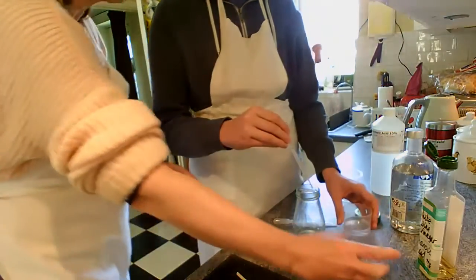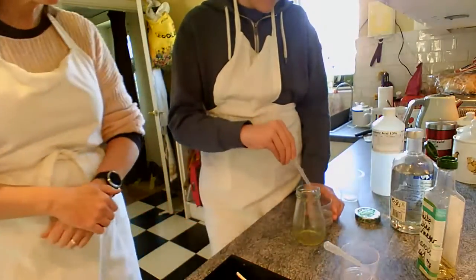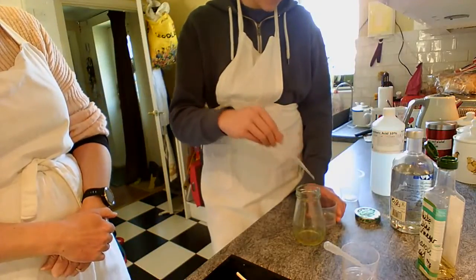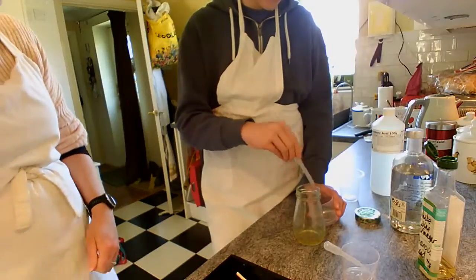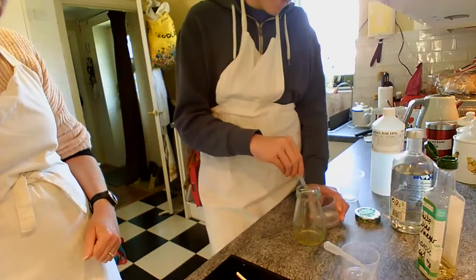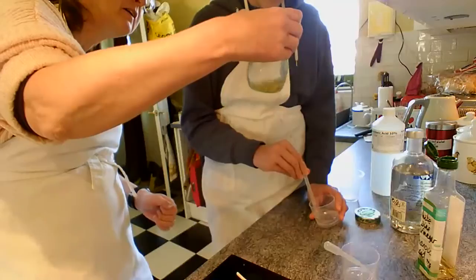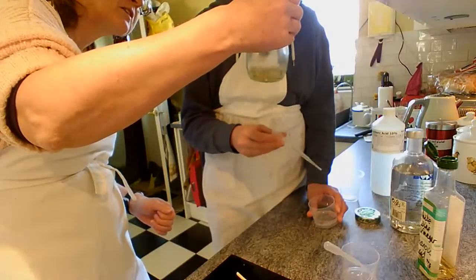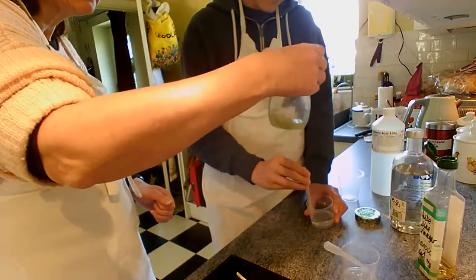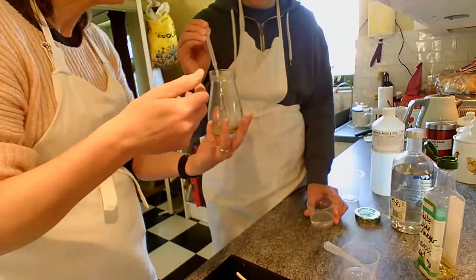Okay, so we'll use a different pipette because we don't want the reaction taking place inside the pipettes, and try and put the same number of pipettes full into there. I lost count. Okay, I'll trust you to gain an idea of how much it was then. Can you see anything happening in there? I think the colour's changing slightly. And it still smells of vinegar.